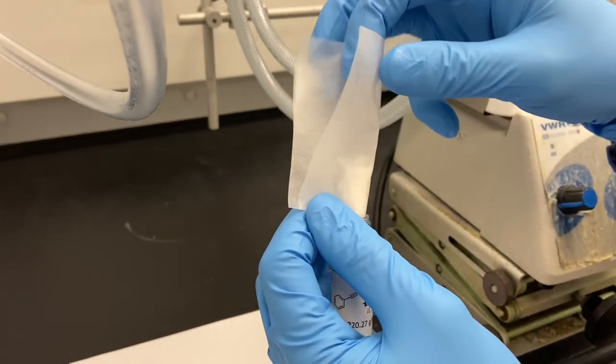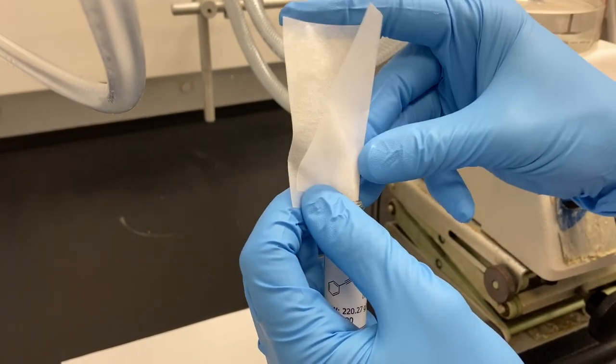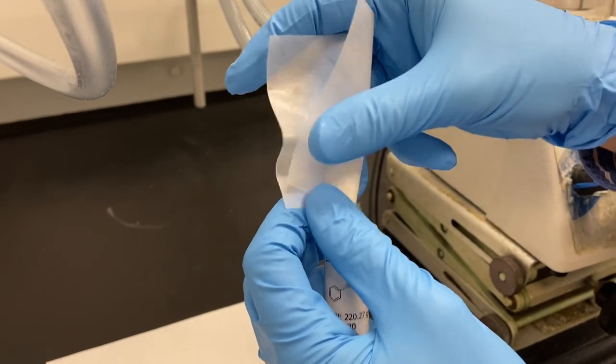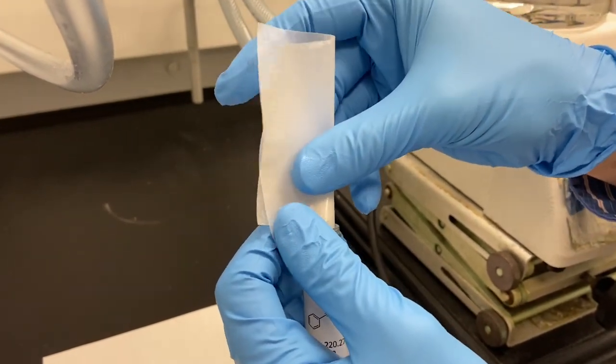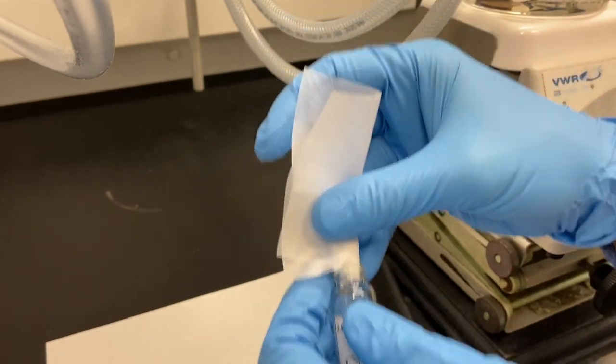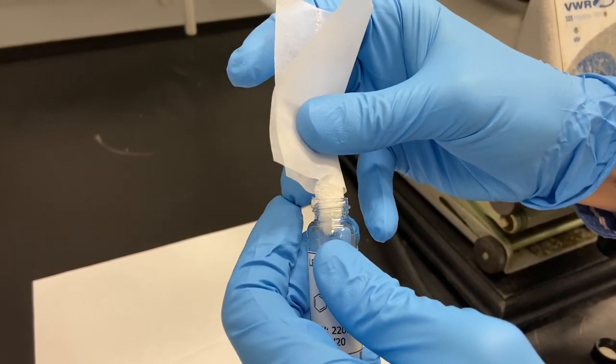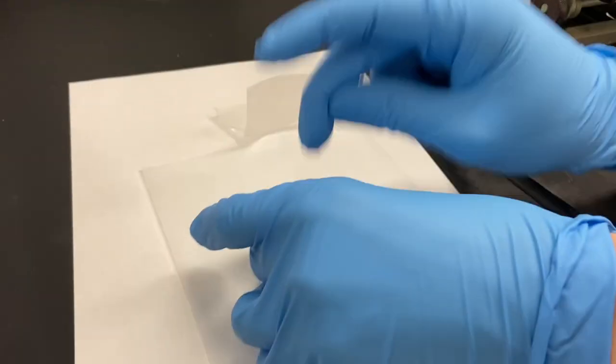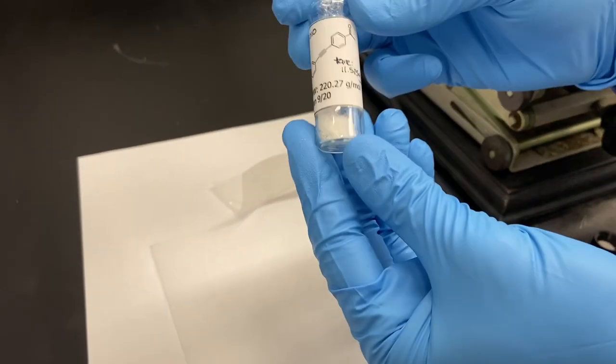It's a bit hard sometimes to convince crystals to go where you want them to. Eventually something drops to the side. That's not too bad, that's why I had put some paper down. I can easily retrieve that.